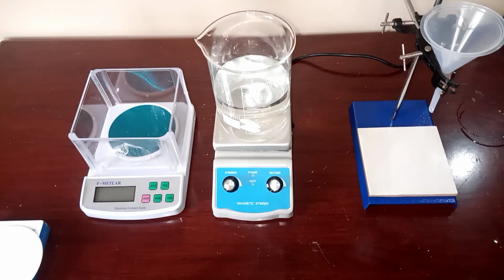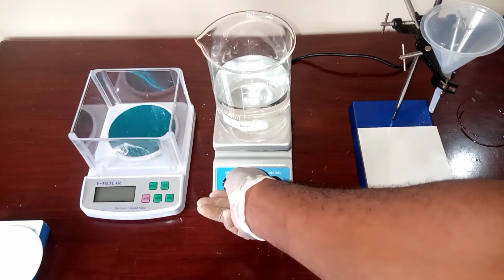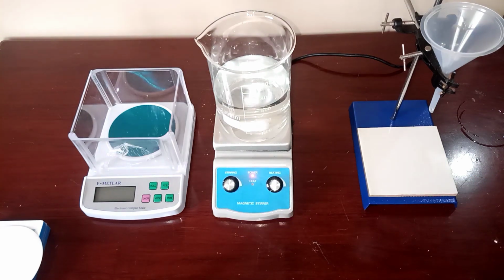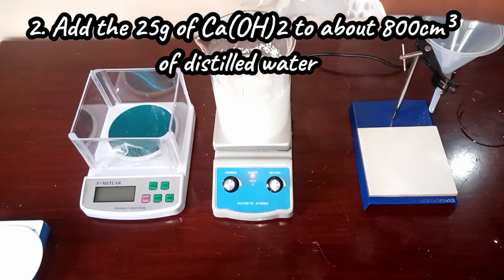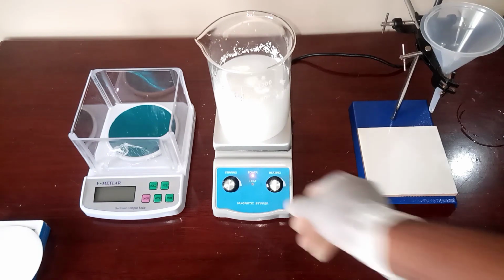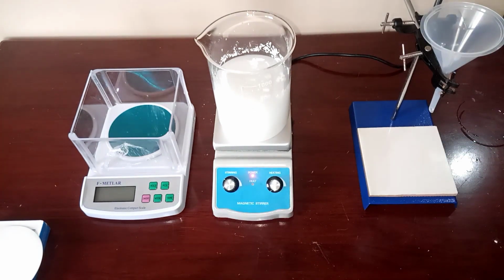If you don't have this, you can use a stir rod. Alright, you don't want to spin it too fast so that you don't spill the water out. You add the 25 grams of calcium hydroxide to about 800 cm³ of water, and you stir properly to ensure that the solute is dispersed homogeneously in the liquid.